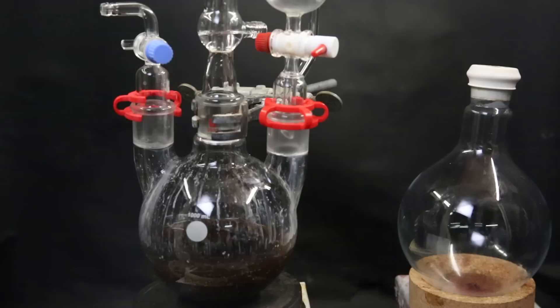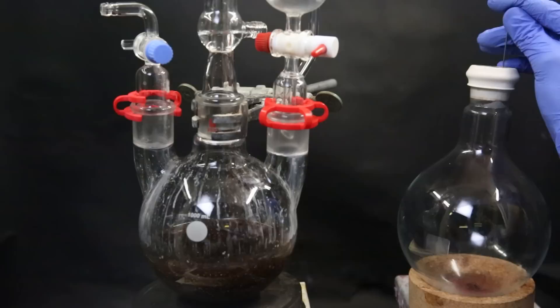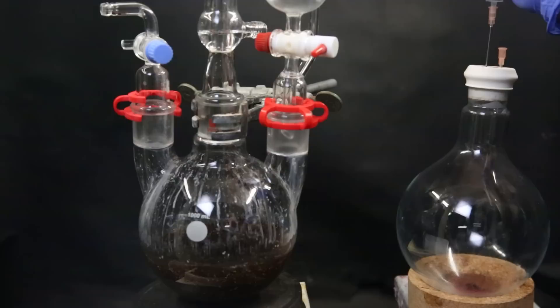When that is done, I set up a flask with a septum next to it. Since I want to reuse the flask that the reaction was done in, and I also don't want to use all of my Grignard reagent right away, I want to transfer the Grignard reagent to another flask. To do that, I will do a cannula transfer so that it doesn't come in contact with air and moisture. I add a needle to the flask on the right with a large bore diameter, which will serve as the exit.